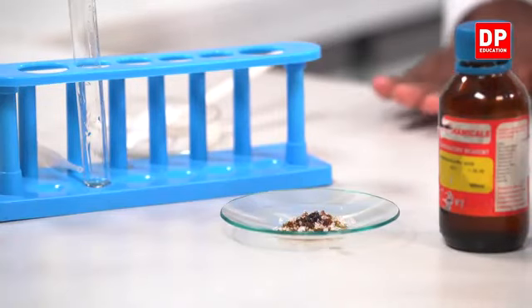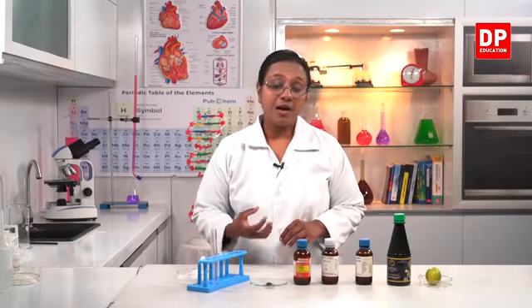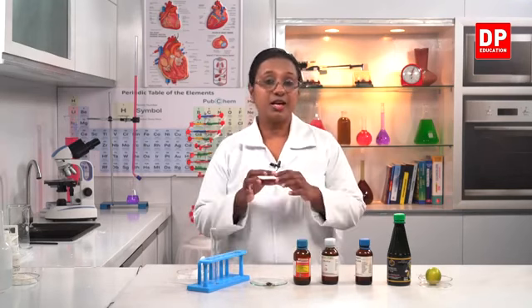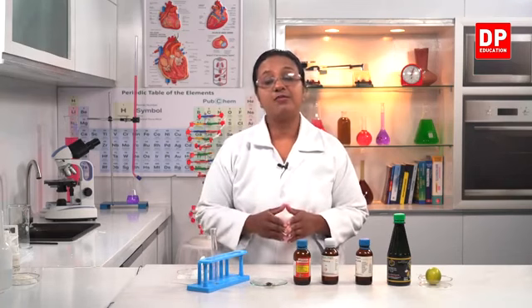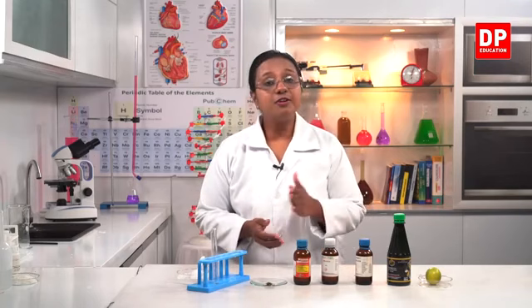Now similar to this, now this is a tile, if this was wood like in your school labs, if you spill concentrated sulfuric acid from the wood, sulfuric acid will absorb water, so only the carbon will remain. So that is also another activity. You can take a small piece of wood and onto that you can pour a little amount of sulfuric acid. It has to be concentrated. Then it will become black in color. That's because after water is absorbed, only the carbon will remain.